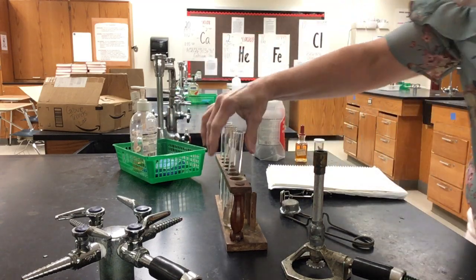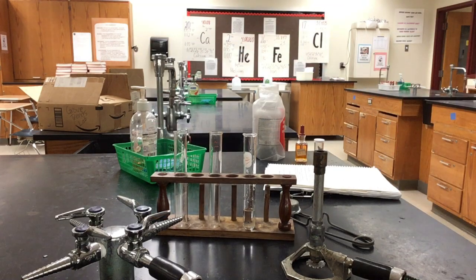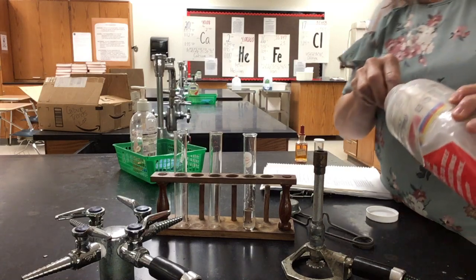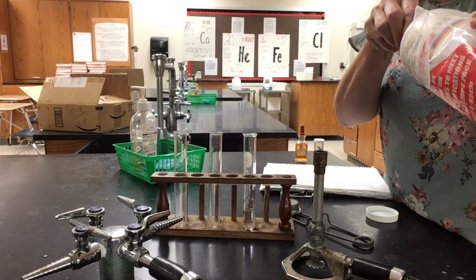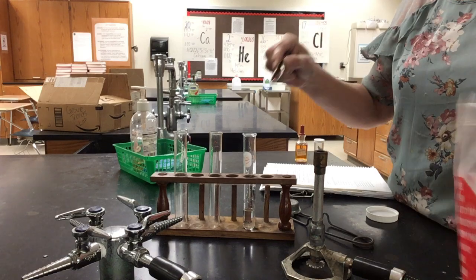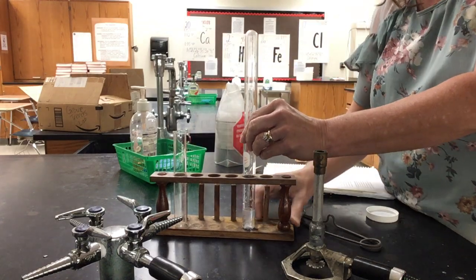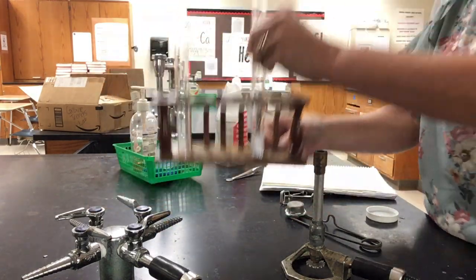And then I'm going to add a piece of calcium, and I'm going to look for a reaction in there. Calcium I do not want to touch with my hand, so I'm going to use some forceps to put it in. And I'm also going to cover it. It's going to create hydrogen gas, so I want to cover it and trap the hydrogen gas like we did when we reacted zinc and hydrochloric acid. So put my calcium in. I'm going to put the second test tube over top of the first and catch any gas that's created. You can see it bubbling.